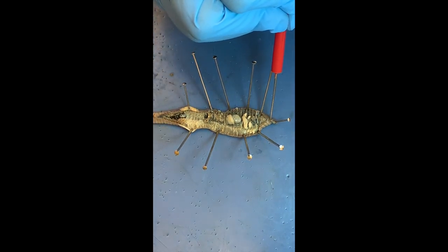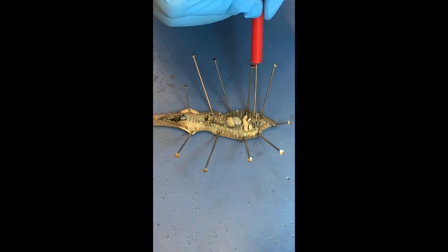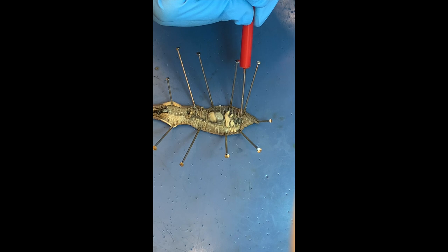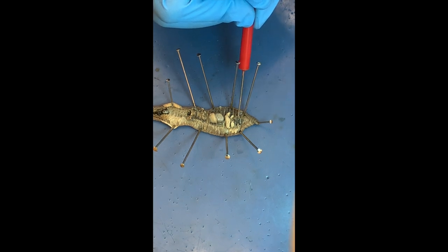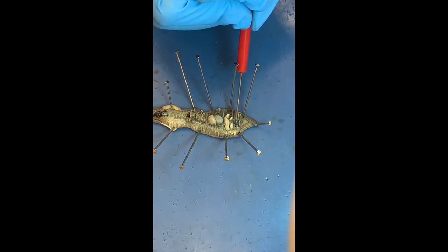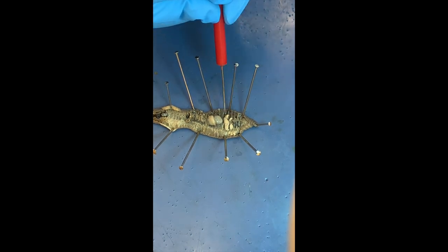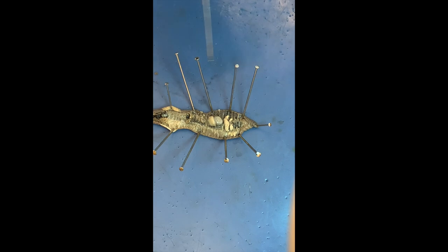Now let's go back toward the oral end. What are those black little structures? They look like little bridges — I can see four or five of them. You mentioned they have five pairs of hearts — those are the hearts, also called aortic arches. They're dark because they were filled with blood. So we see the repetition of segments clearly here. This would be the equivalent of their thoracic area, and then posteriorly the abdomen with the intestine.